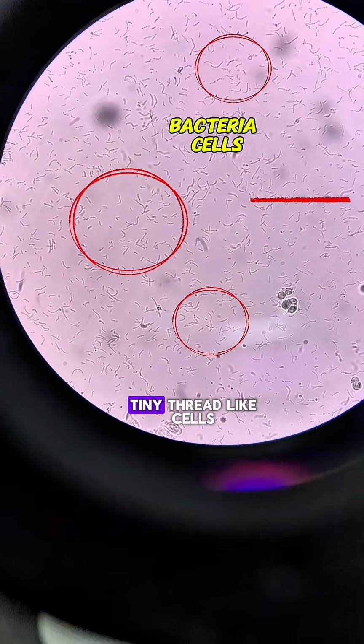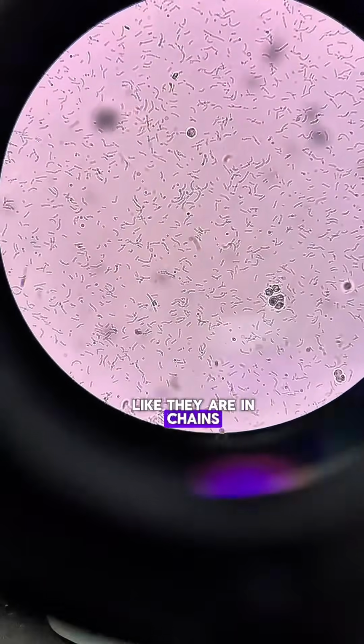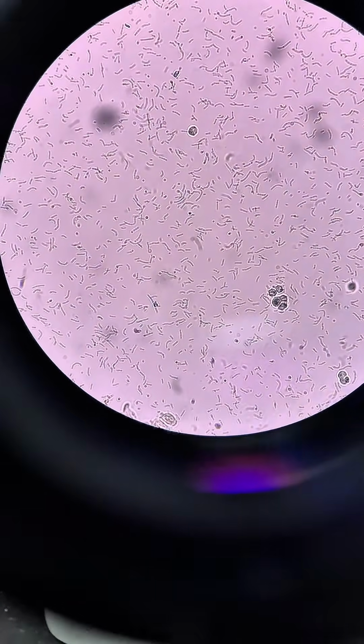Bacterial cells are tiny thread-like cells and sometimes they look like they are in chains, as you can see in this picture. Isn't it beautiful?